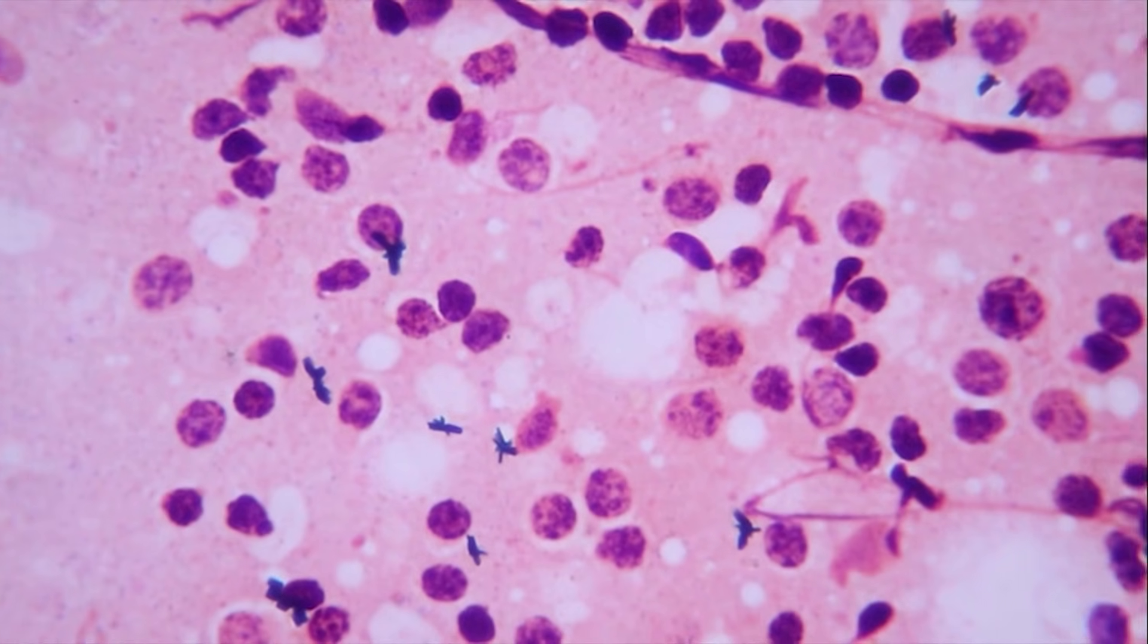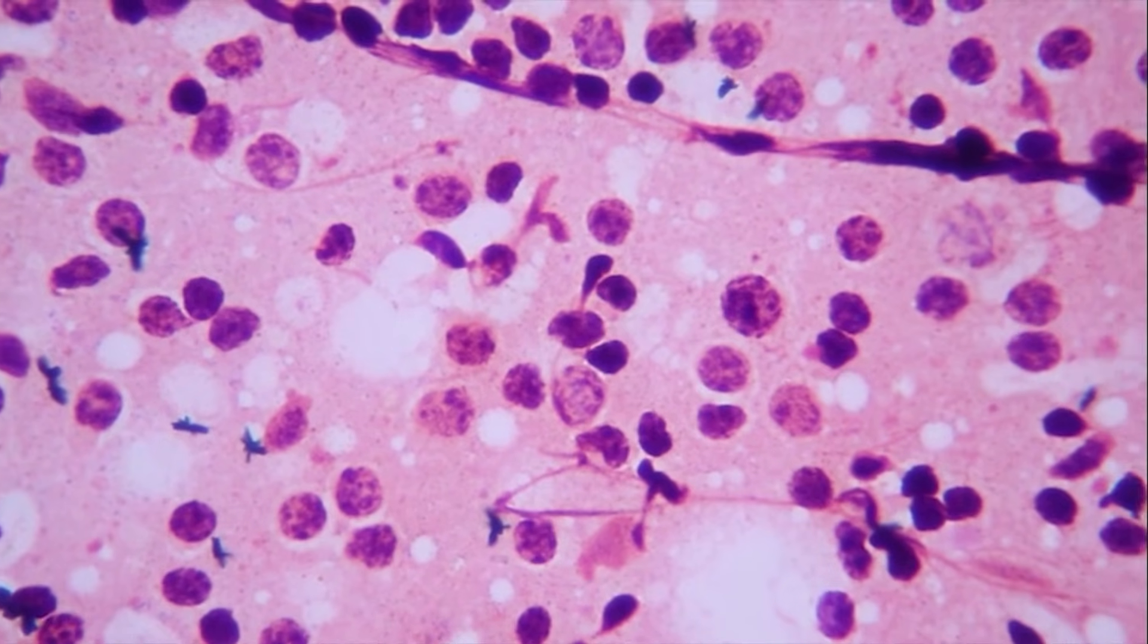Gram-positive cells will appear purple and Gram-negative cells will appear pink.